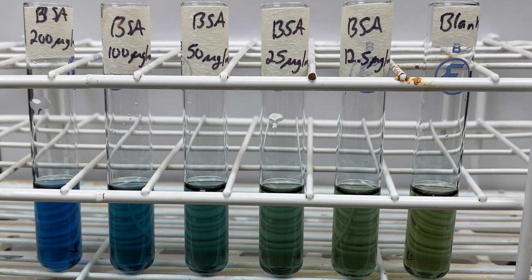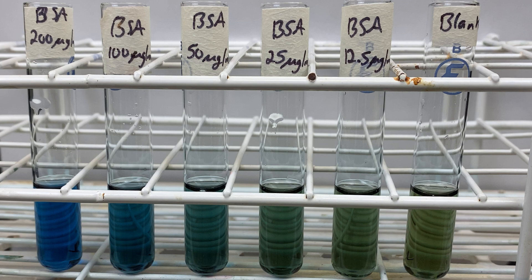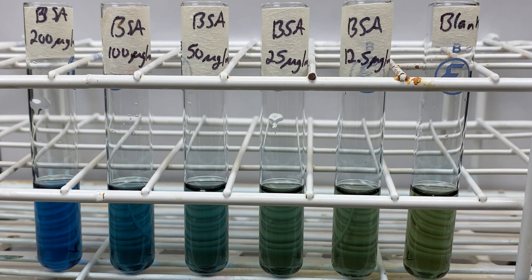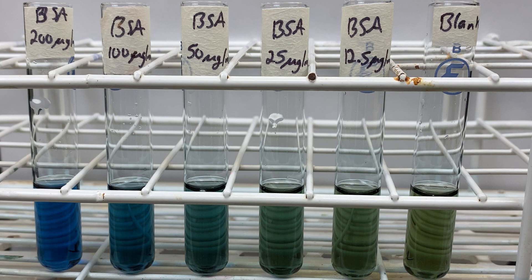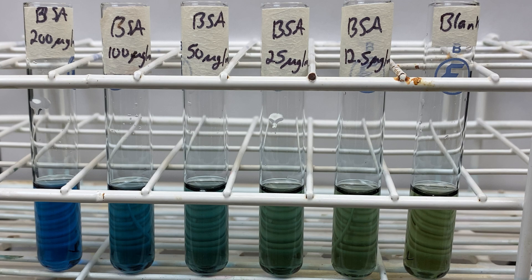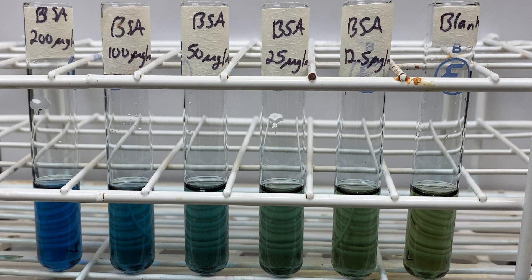This is an assay we can use to quantify proteins. The chemical Coomassie Brilliant Blue, which is normally a brown-green color, will turn a blue color when it binds to proteins. More proteins, the more intense the blue color. You can see in the image here, we have a blank having no protein, as well as various concentrations of our BSA protein. As we increase the concentration of protein, you can see our solution turns from that brown-green color gradually into more of a blue color. We can then use a spectrophotometer to analyze the absorbance at different wavelengths to determine what the concentration of protein is in our solution.